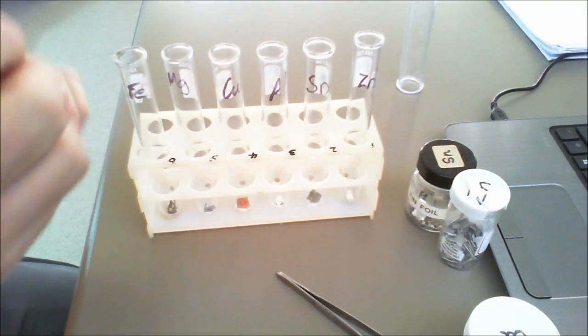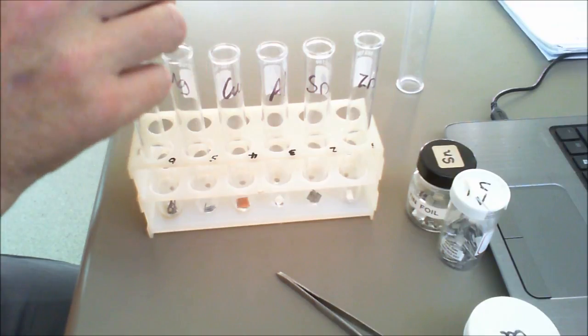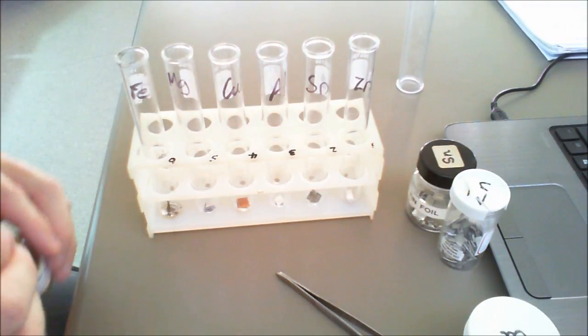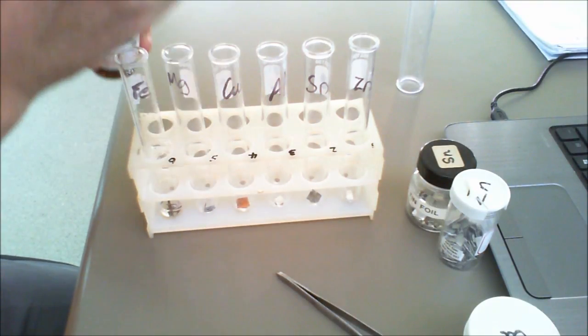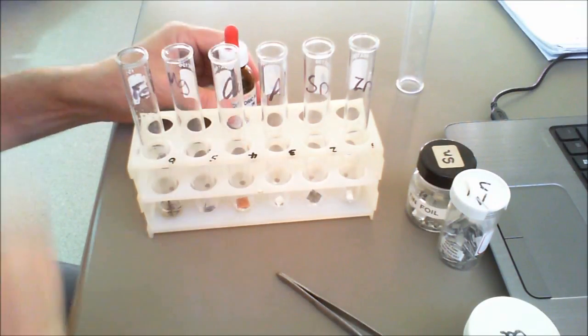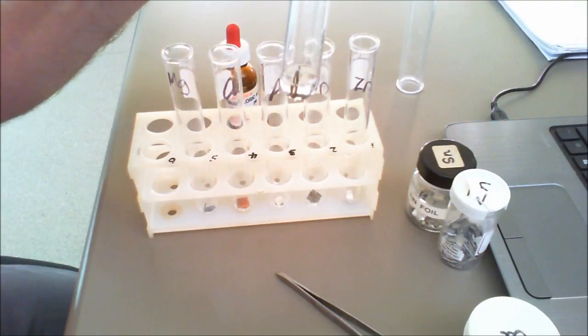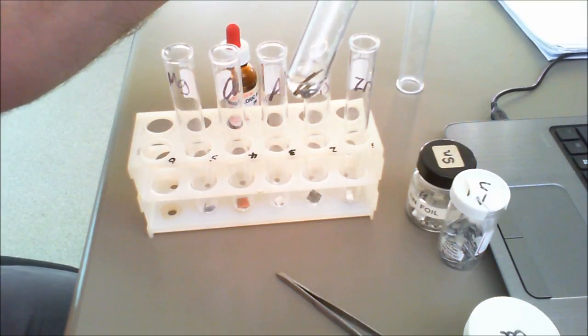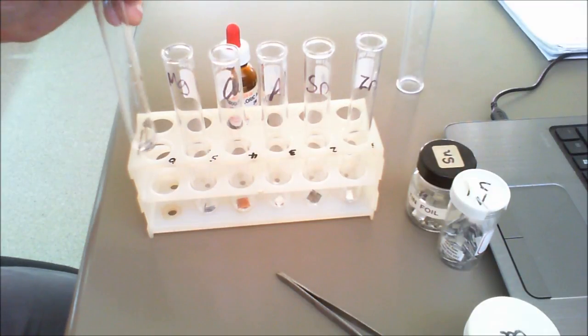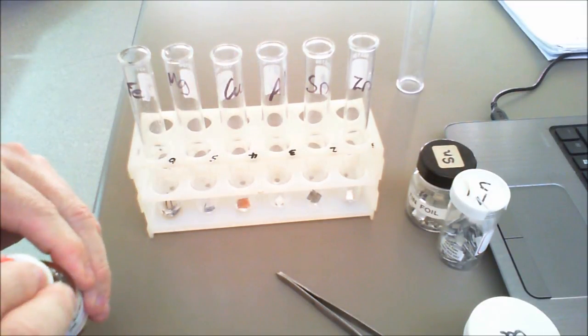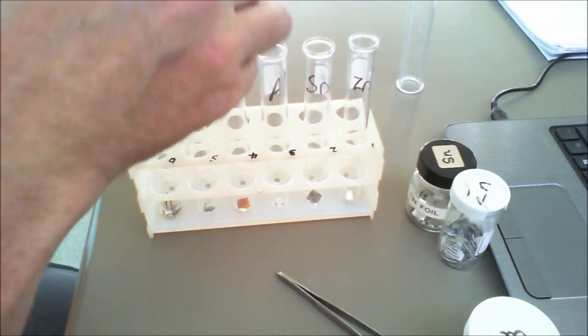So what we'll do is place over the top, two squirts into each of these. Now, probably it's not a bad thing to take it out and have a bit of a look where we can. Okay, there's just a little few bubbles forming around the outside there of the iron. Not a great deal of movement.